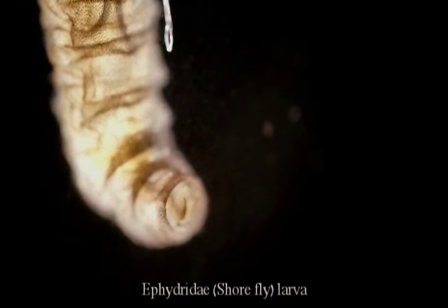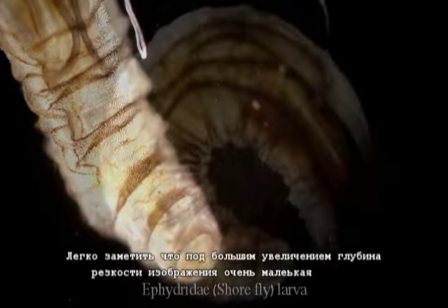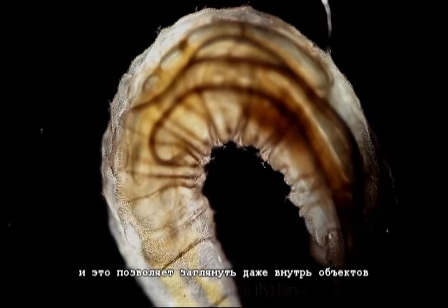As you may have noticed, under high magnifications, the depth of field of the image is very low, and you can even see inside the bodies of animals.